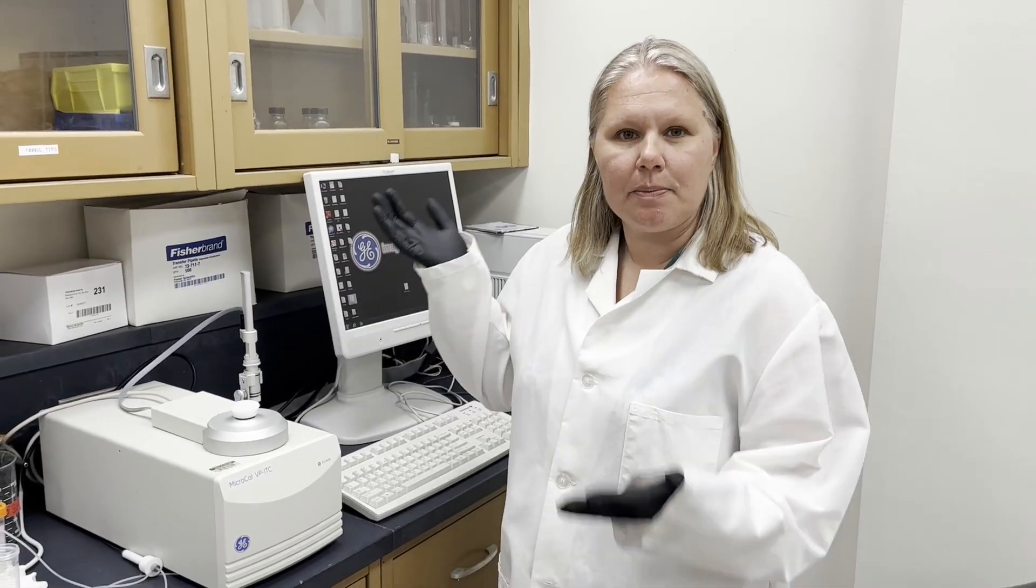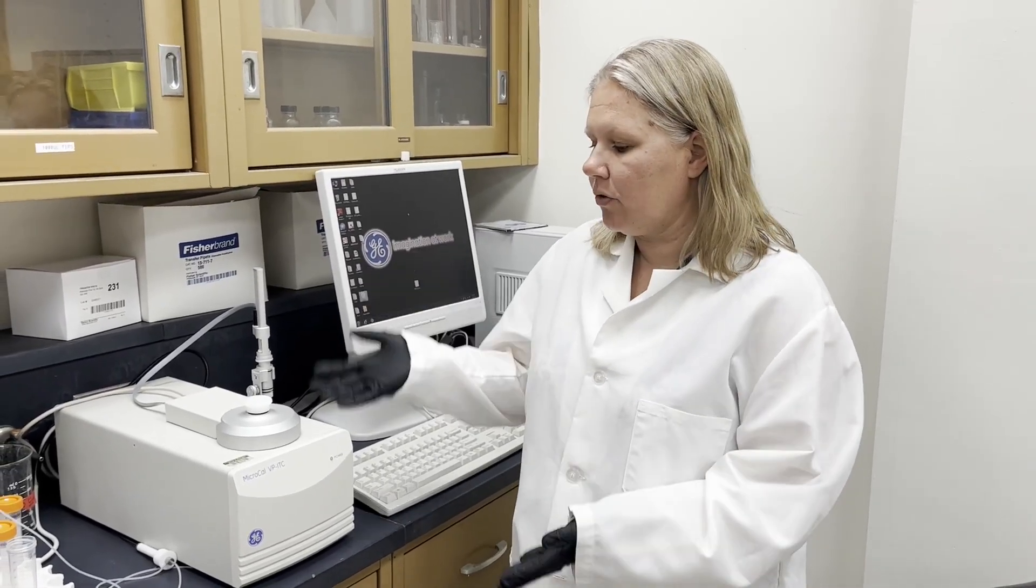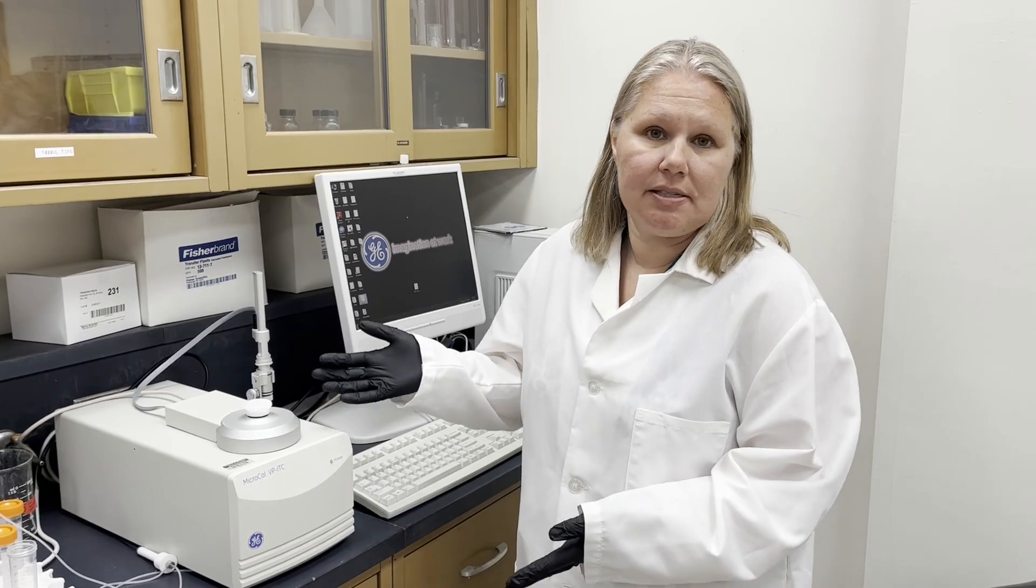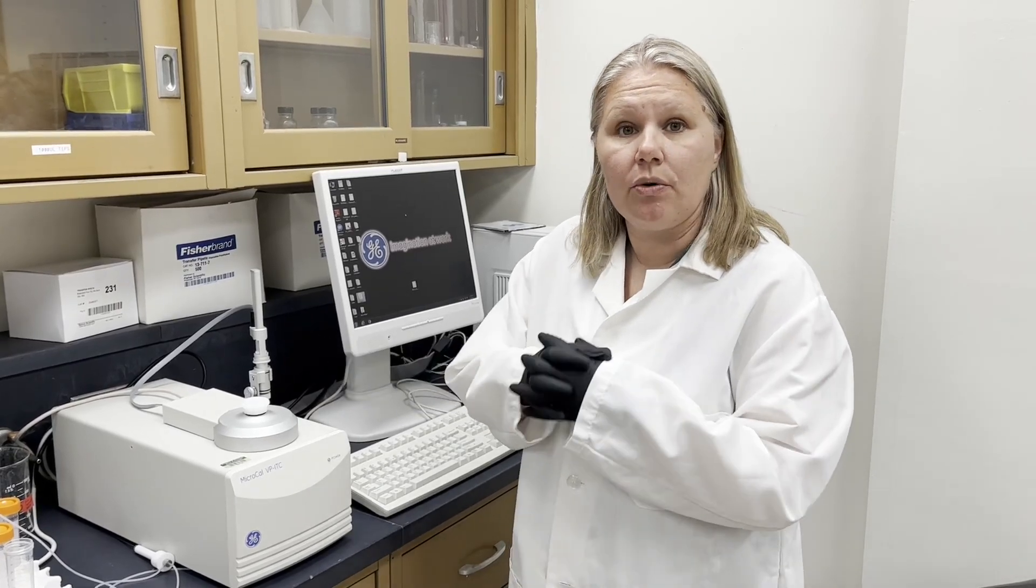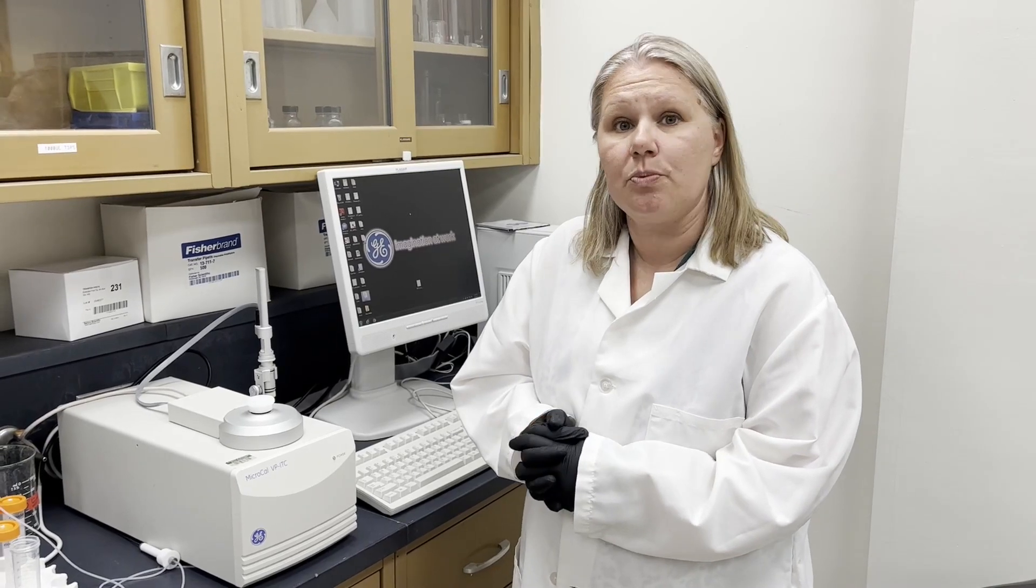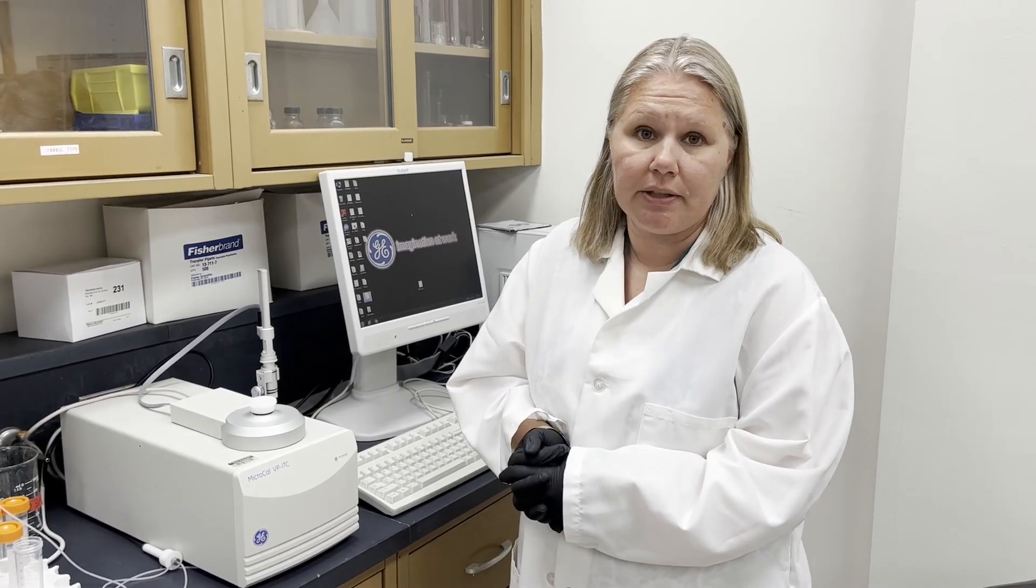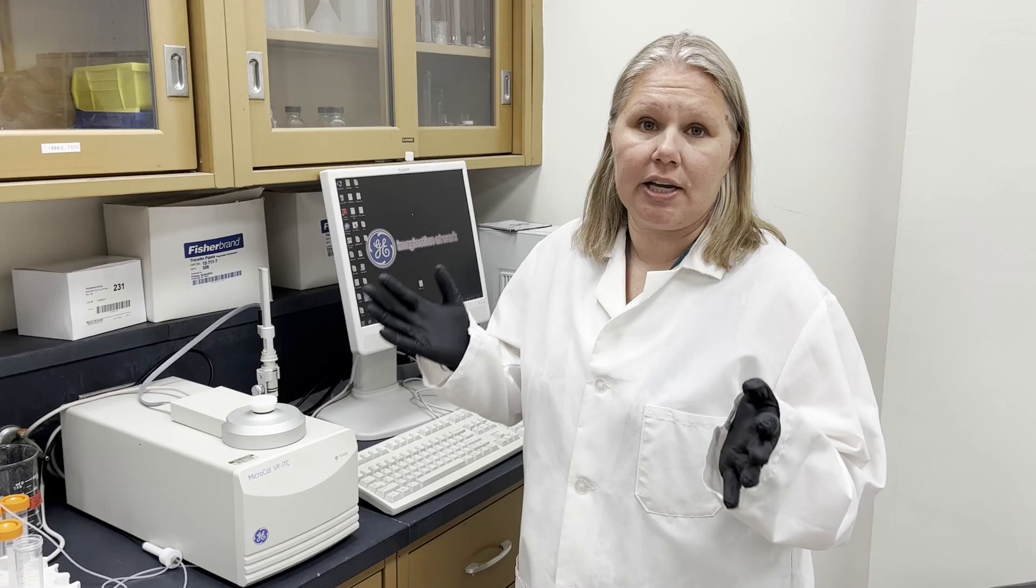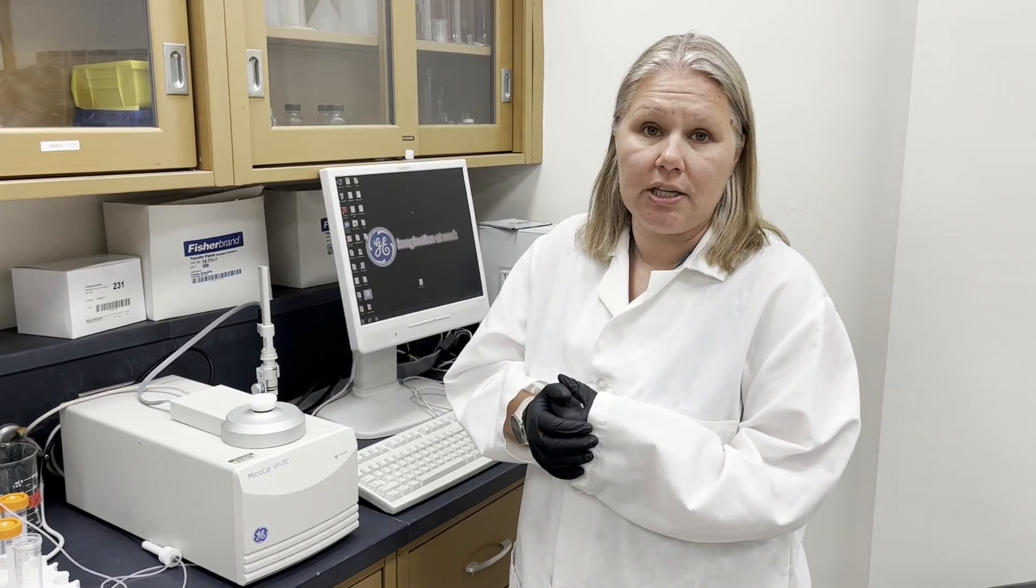Today I'm going to be explaining how to use the MicroCal VPITC instrument. This instrument measures thermodynamic interactions between protein and protein, protein small molecule interactions, or any interaction that involves a change in heat.